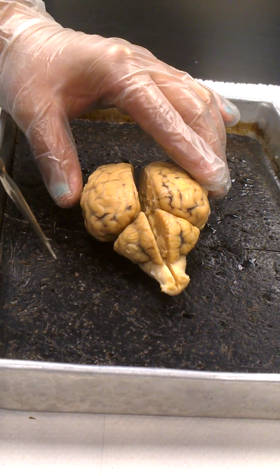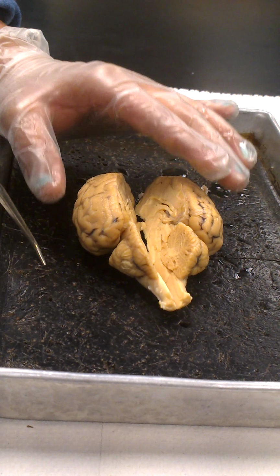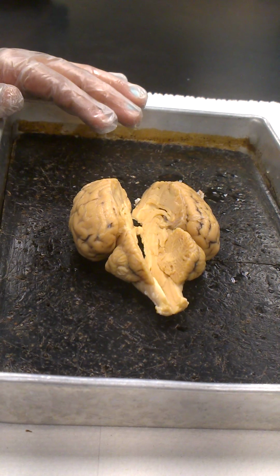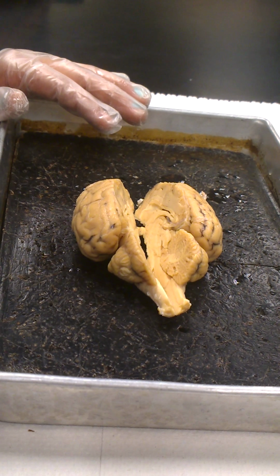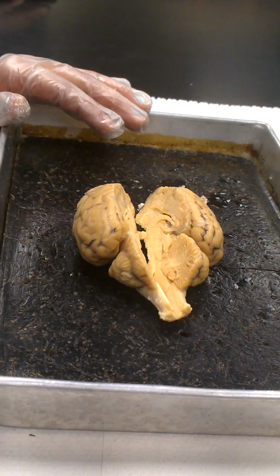There's also a central fissure, which is a little difficult to see on a sheep's brain. It's a structure which is pretty remarkable on a human brain, but on a sheep's brain it's kind of indefinite. But basically it's a dividing line between the frontal lobe and the parietal lobe. I think on this brain our central fissure would be right along in this groove, not as deep as the other fissures.